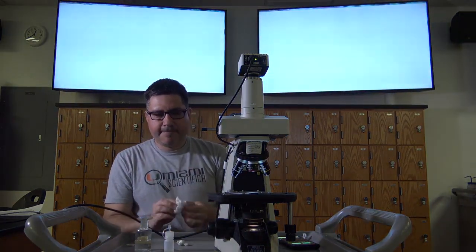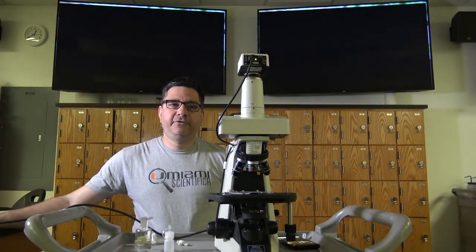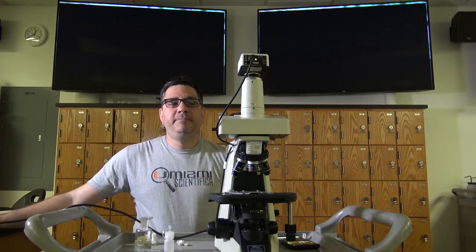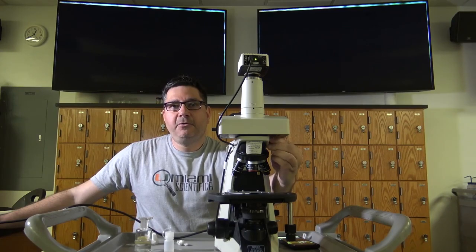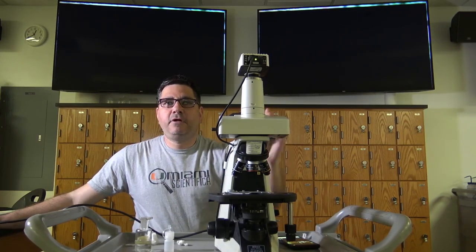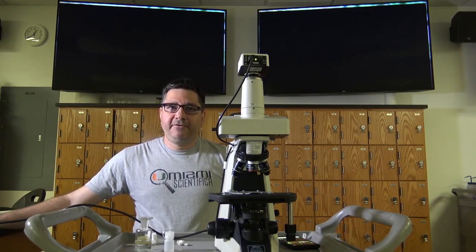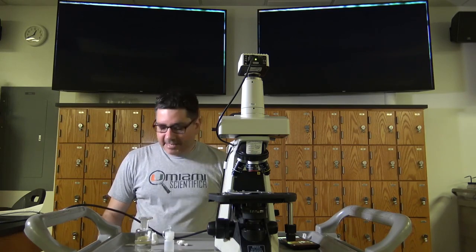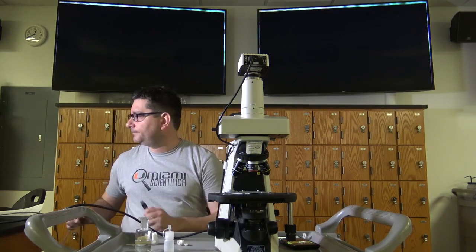position. Power off your microscope, and if you have a trinocular scope, push in the lever for the trinoc head, and be sure to secure the head to your scope so that it doesn't fall off in transit. Next, unplug your microscope, both cables. Next, unplug the cables from your benchtop.